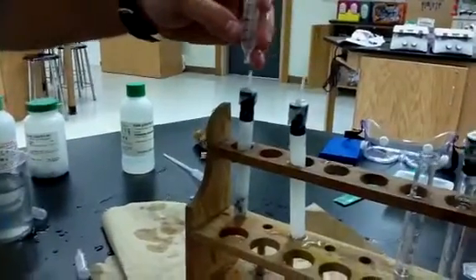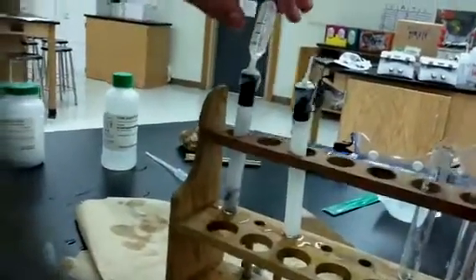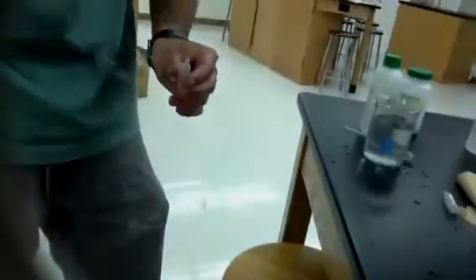Okay, we've got about 1.5 parts oxygen. And we're going to try to get, are you ready, Stephanie? Yes. Light, light, light. Okay, Brandon, eyes over here. And that's a combustion reaction that you might see, eyes up here, you might see in this lab.